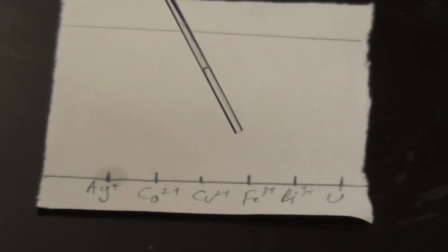And that's a good idea if you want to make sure that you get a good concentration of ions in the spot is to spot it again. But you need to wait for the solvent to evaporate a bit before you try and add a little bit more. Of course you don't have to refill it. It's still got sample in the capillary as you can see. So waiting for it to evaporate a bit more and then just a very light tap again, there we go. That's about the size you want.